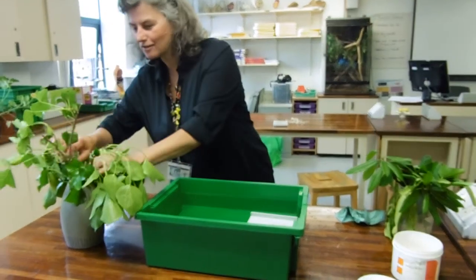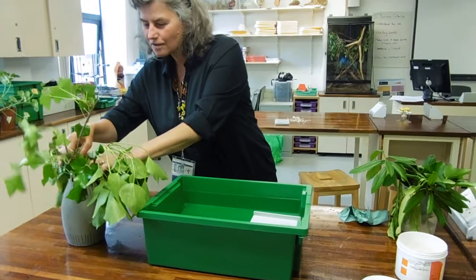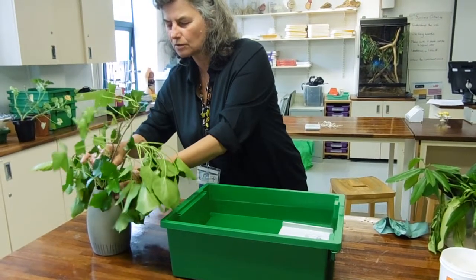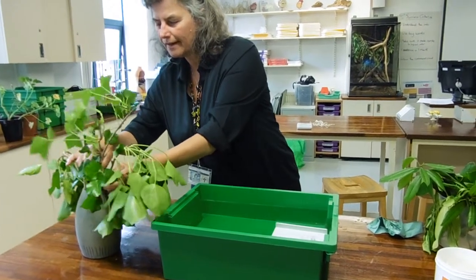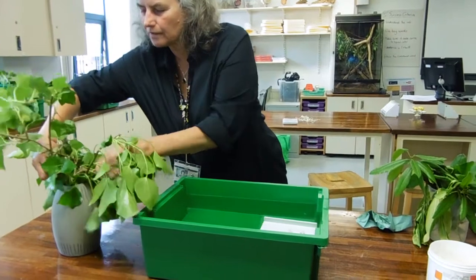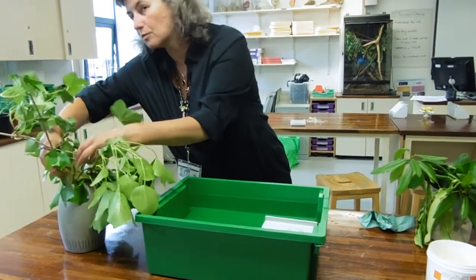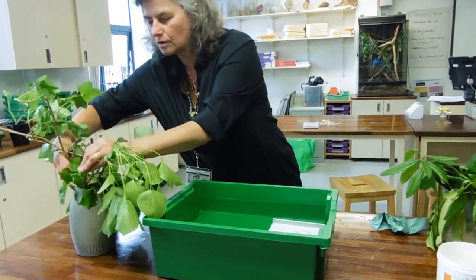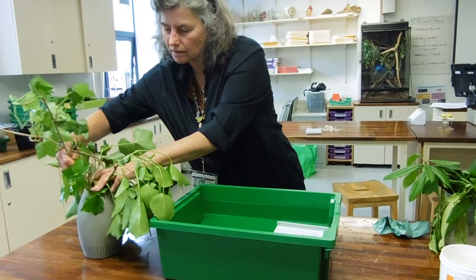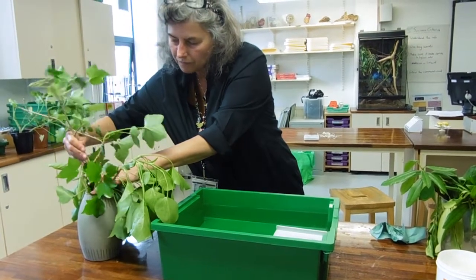Your plant also needs an unbroken column of water. Theoretically what I should be doing here is putting the vase under the water, like you would do with your cut flowers to stop them dying.